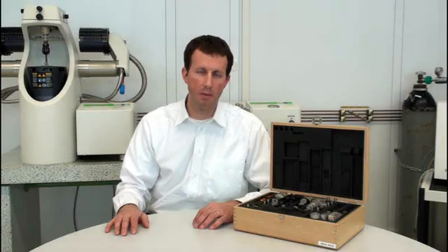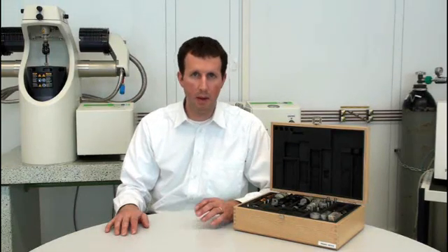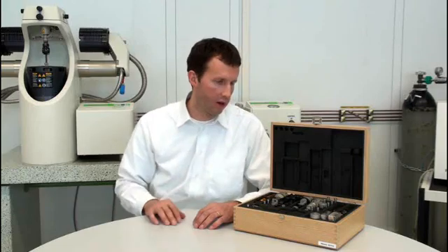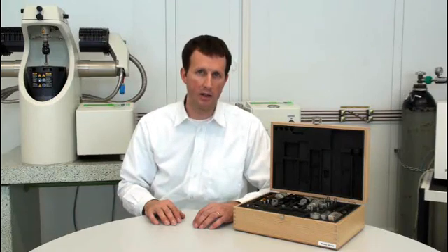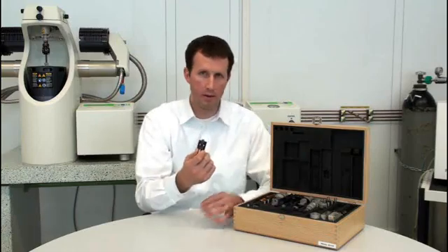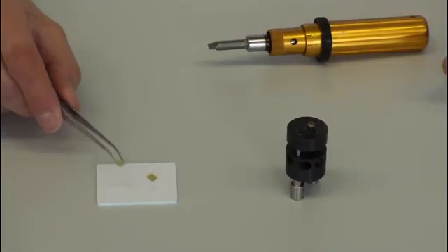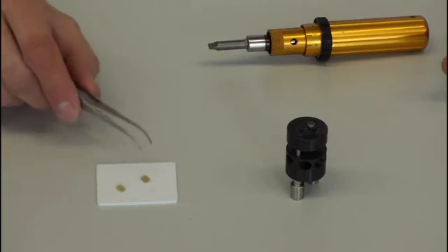Let's move on to the actual sample preparation procedure. Depending on your application, you have a choice of all kinds of different clamps. I'd like to show you how easy it is to work with the shear clamp.